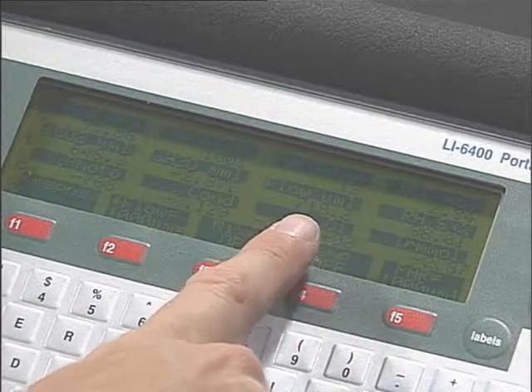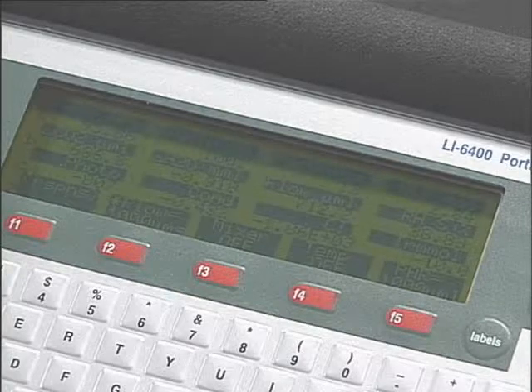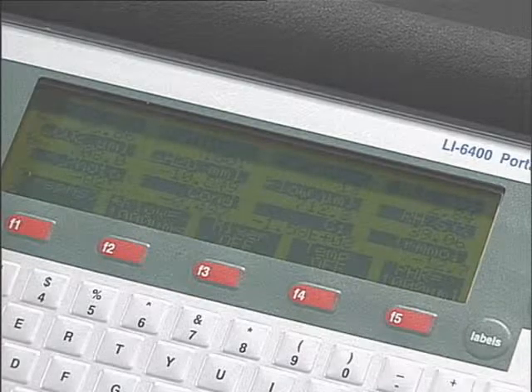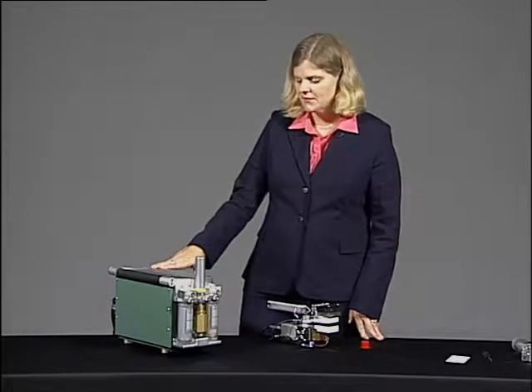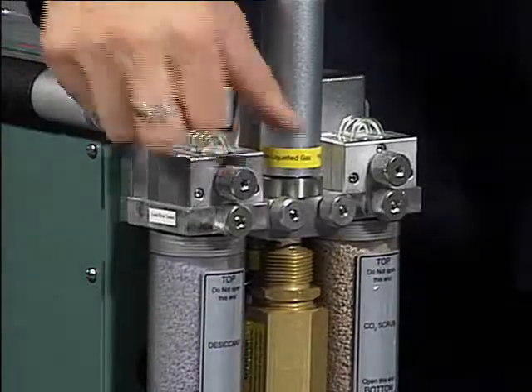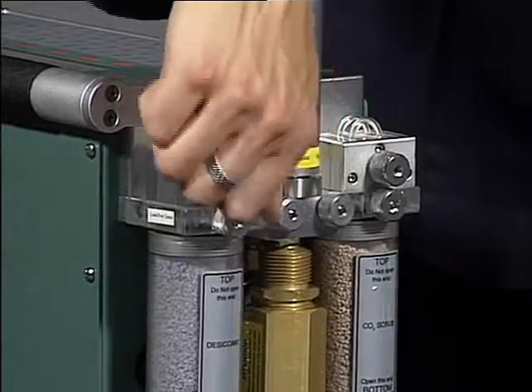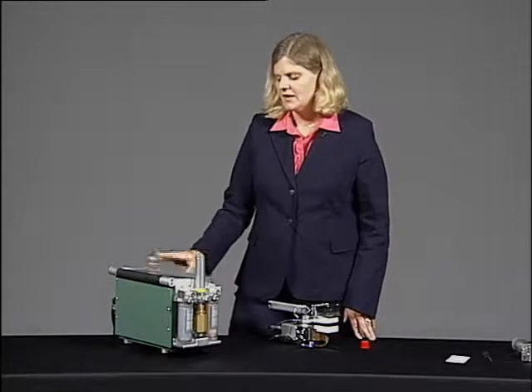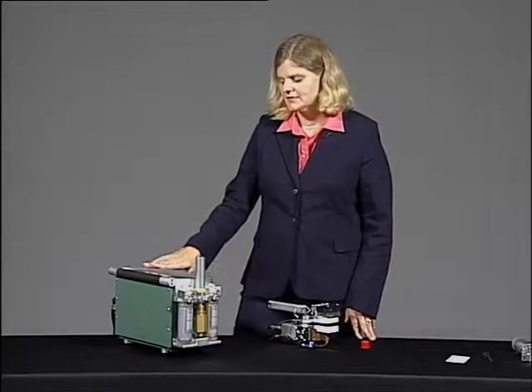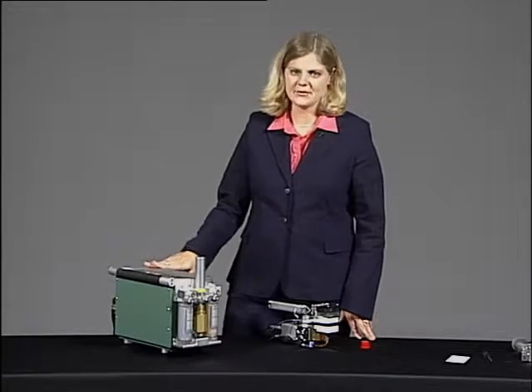And watch what happens on line B for flow. My flow for that particular tube dropped about 8 micromoles per second, which is completely acceptable. And let's go ahead and move your next tube. Again, wait a few moments and then check and see what happens to flow. For my desiccant tube, my flow only dropped 2 micromoles.